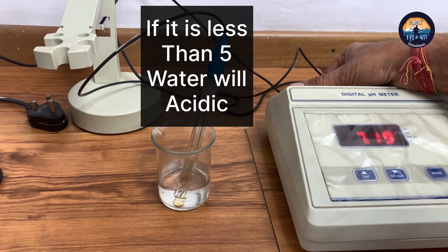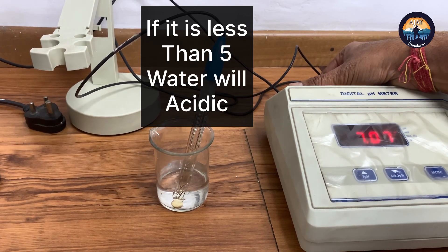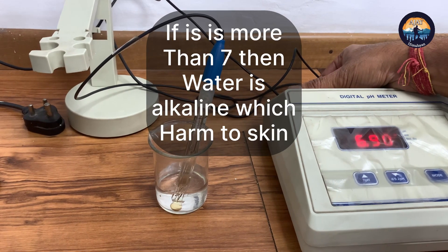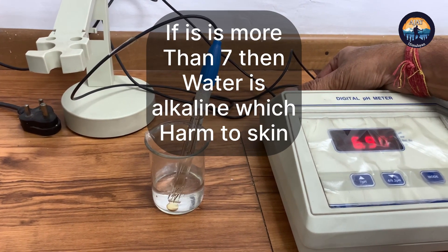You can see the red numbers showing the pH reading. Finally, for this solution we got 6.9, which is passing.